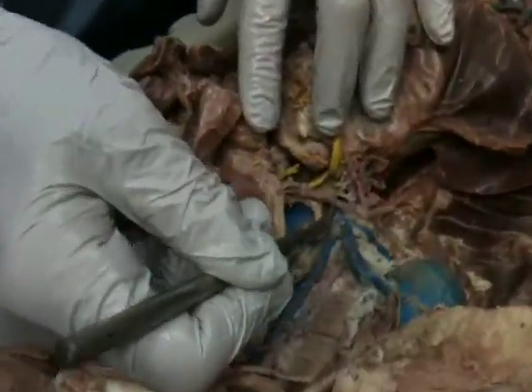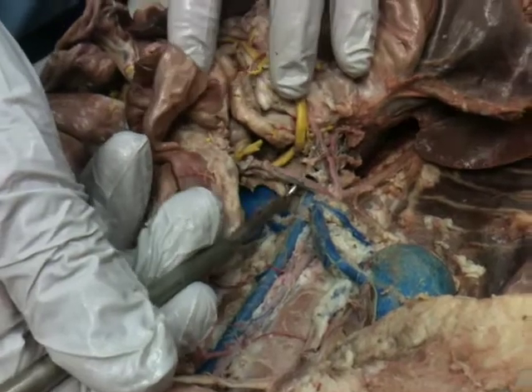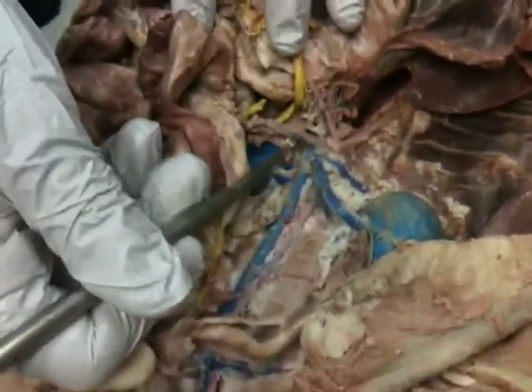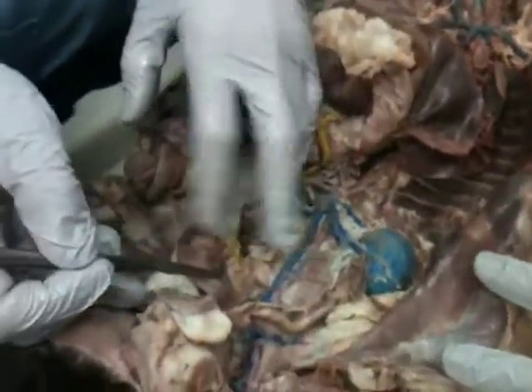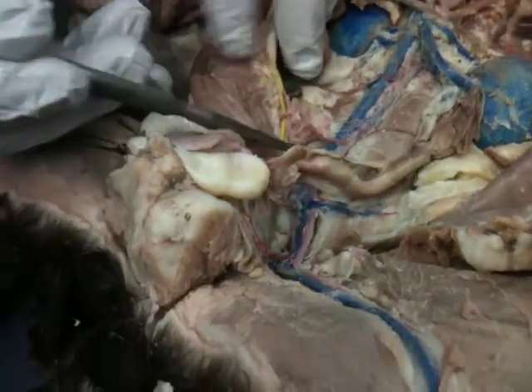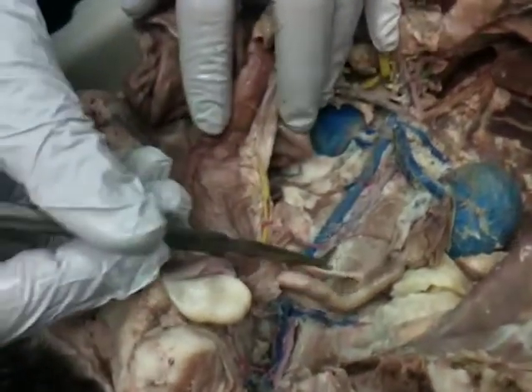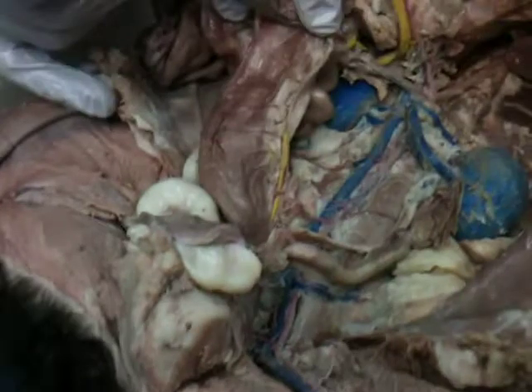So then we have the superior mesenteric artery, and this supplies mostly the small intestines. Okay, well, if we have the superior mesenteric artery, guess what? We have an inferior mesenteric artery, again coming from the abdominal aorta. If you look and see where this is going, it's supplying the colon.